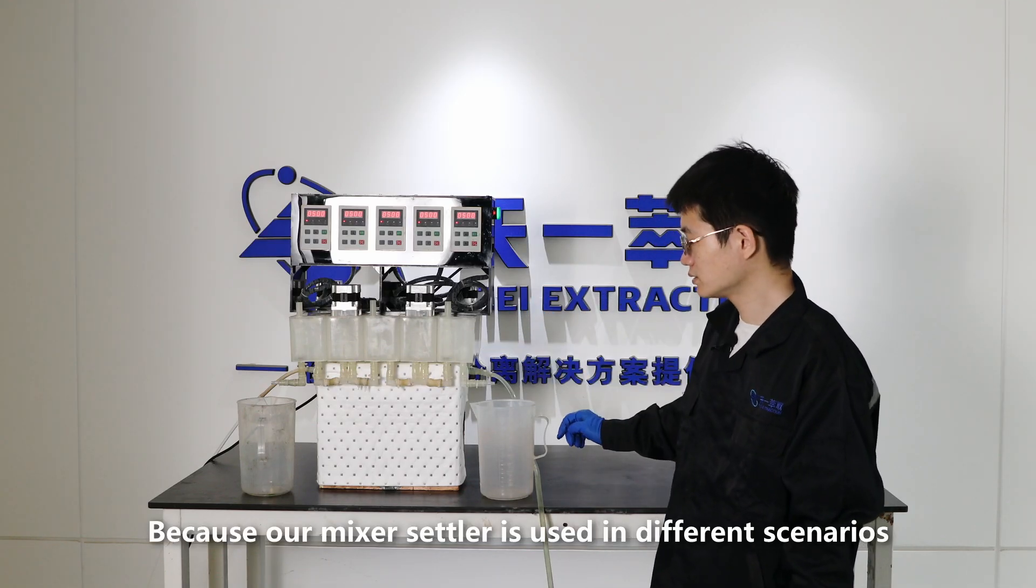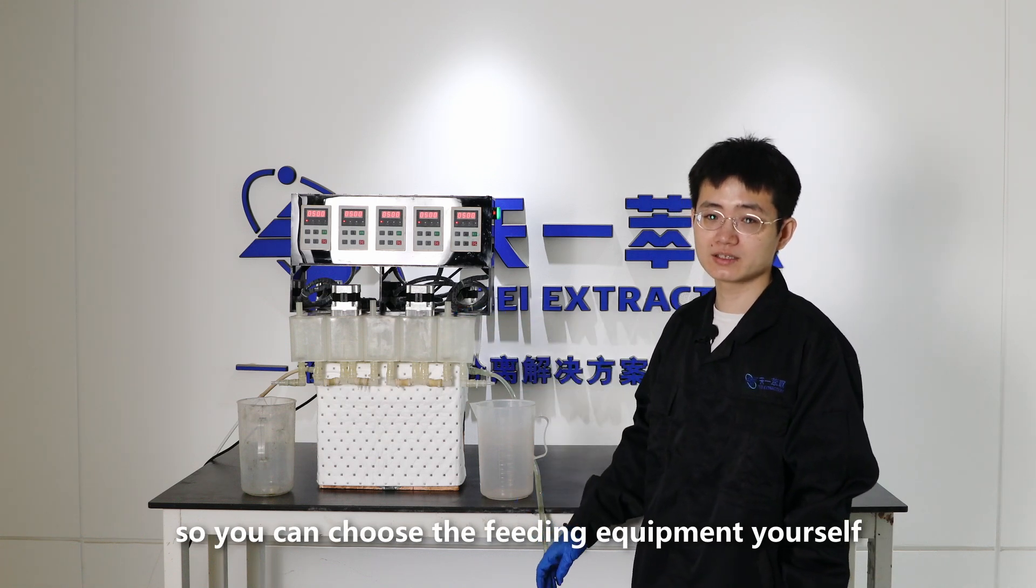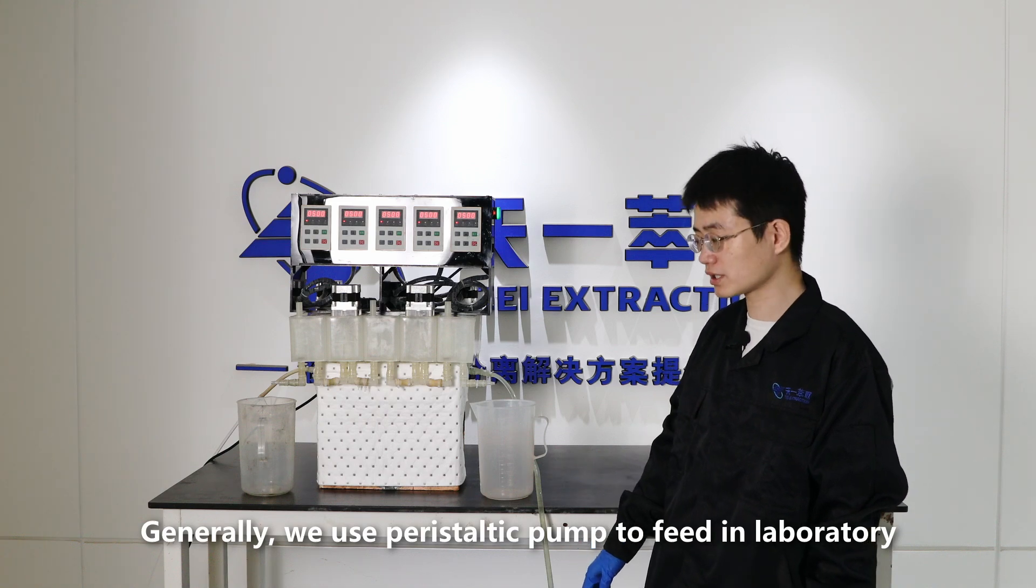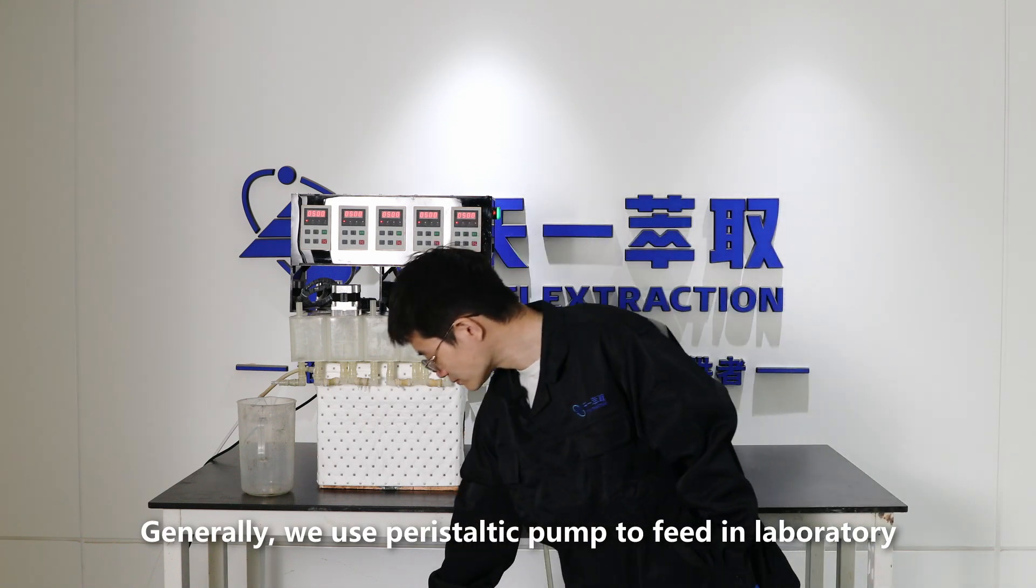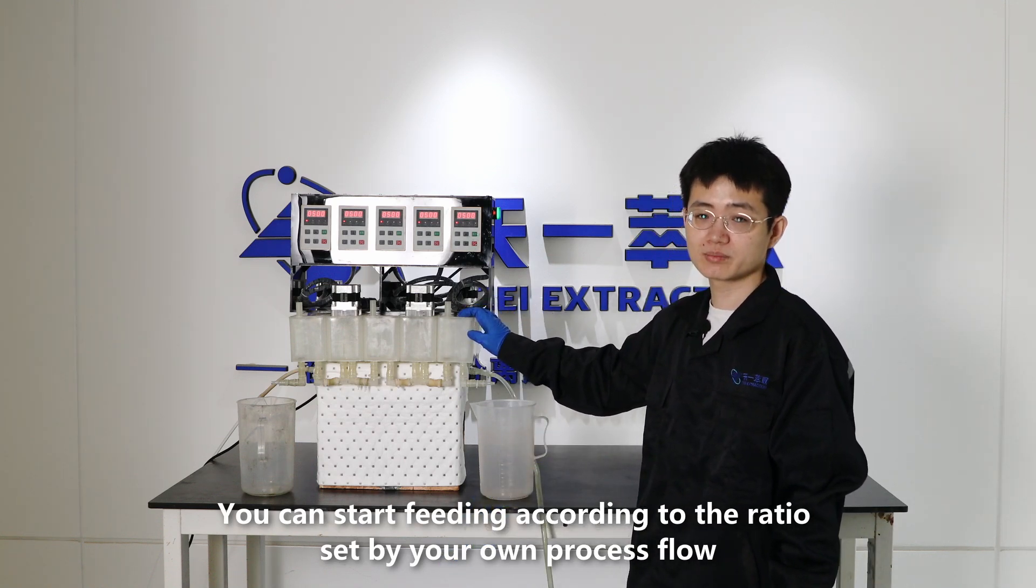Because our mixer settler is used in different scenarios, so you can choose the feeding equipment yourself. Generally, we use peristaltic pump to feed in laboratory. You can start feeding according to the ratio set by your own process flow.